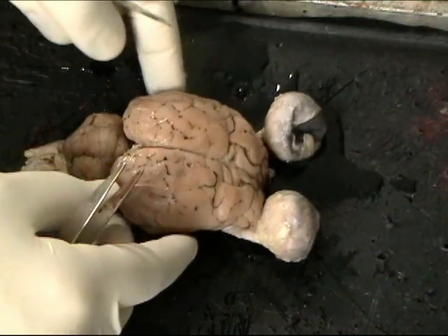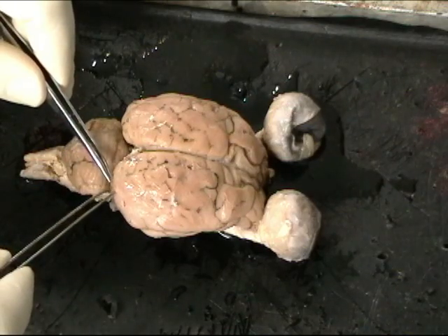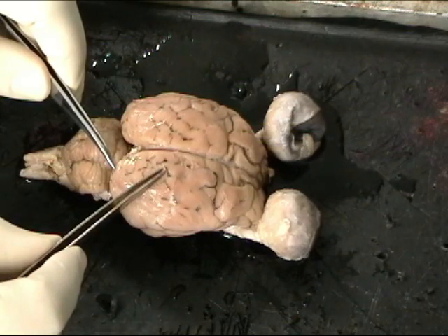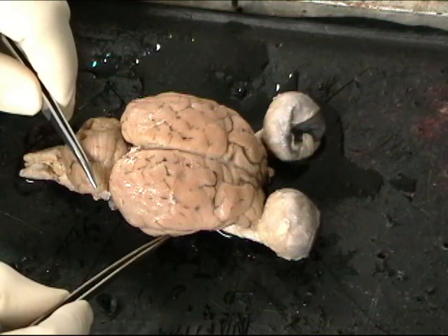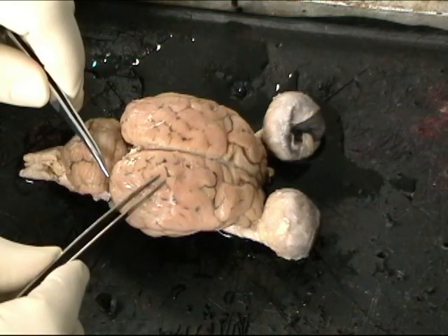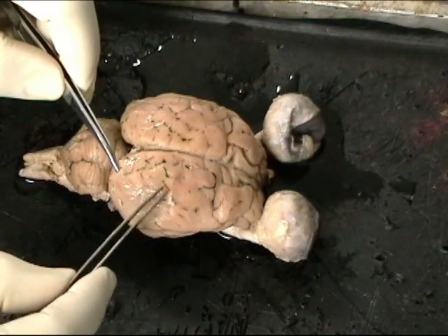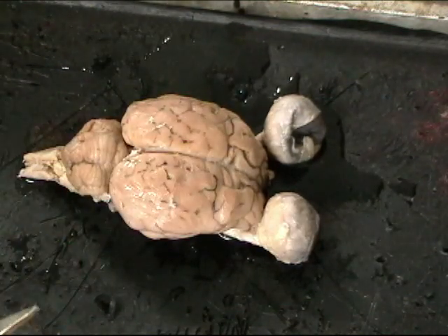All right, let's take a look at the parietal lobe. The parietal lobe back here is also situated right next to the occipital lobe, and again, neurons in the occipital lobe send axons up this pathway towards the parietal lobe. So some visual information is being sent down into the temporal lobe for object recognition. Some visual information is being sent up to the parietal lobe. Now this pathway, some researchers call the vision for action pathway. Visual information in this pathway seems to be used to guide behavior towards objects in the environment.